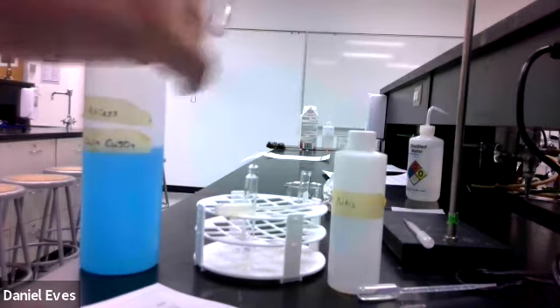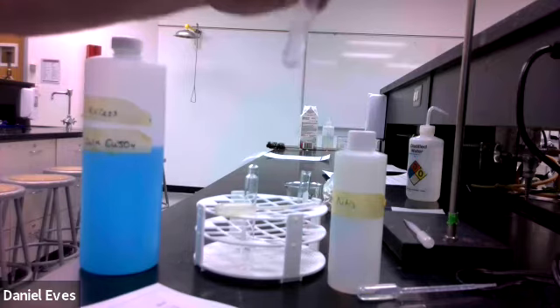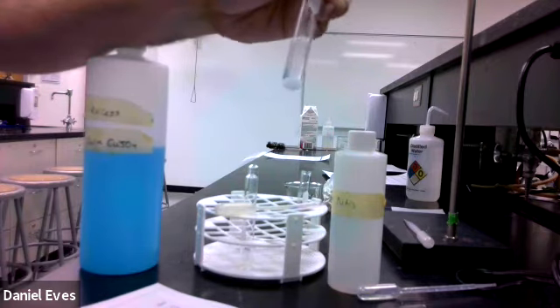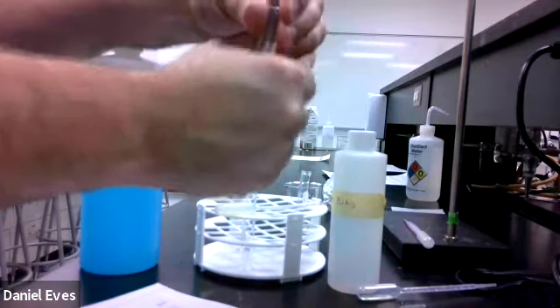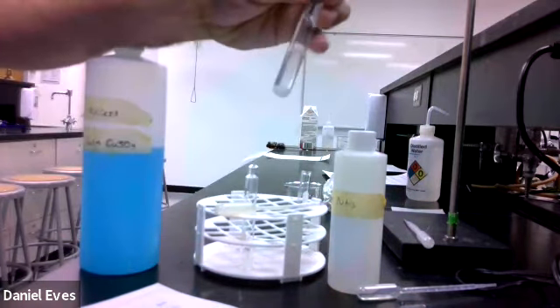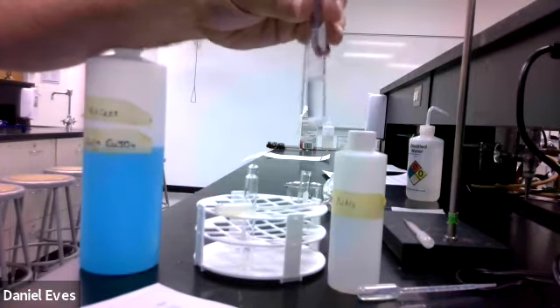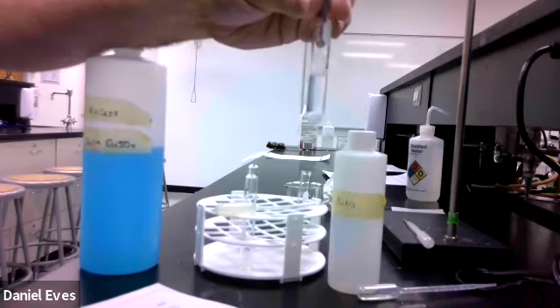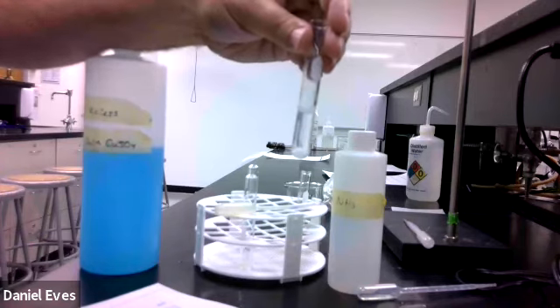Okay, and so it's good that there's a little bit of solid there at the bottom, and there's some solid in the liquid as well. So I'm probably going to have to let this sit. But what we want to make sure is that there is as much ammonium chloride inside of this test tube as possible, because for this next part, the equilibrium, we need it to be a saturated solution. So we're going to go ahead and pause for a little bit.